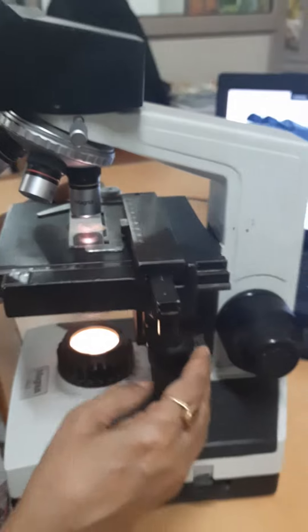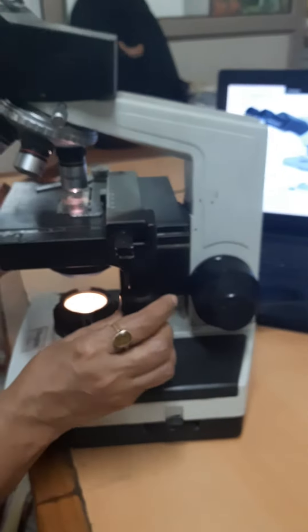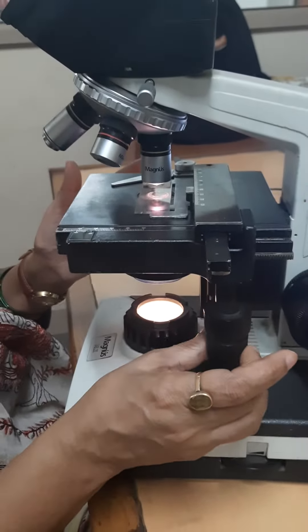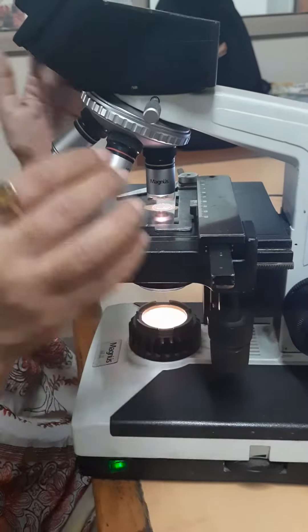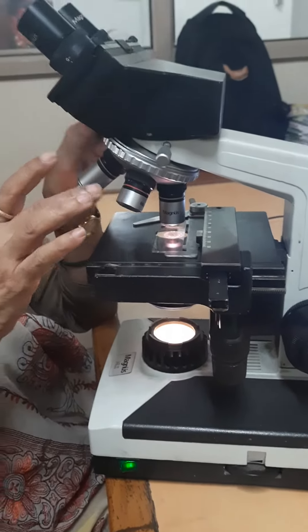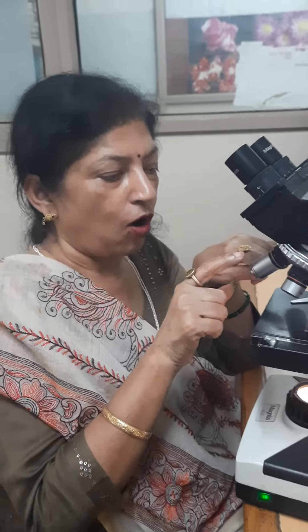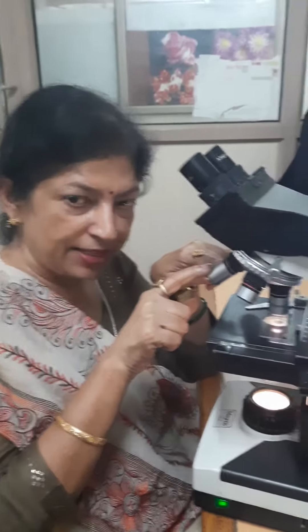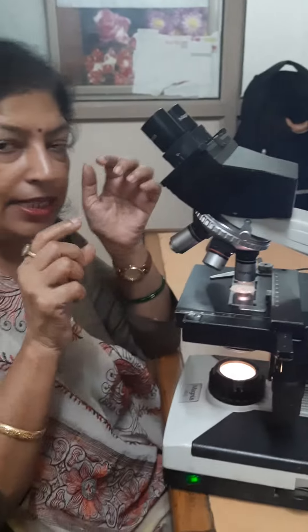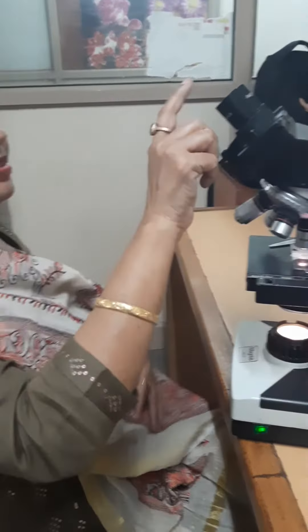This is the platform, and we can move the slide with the help of this knob. We can view the specimen by using the objective lens, which comes in 4 types: 4x, 10x, 40x, and 100x.